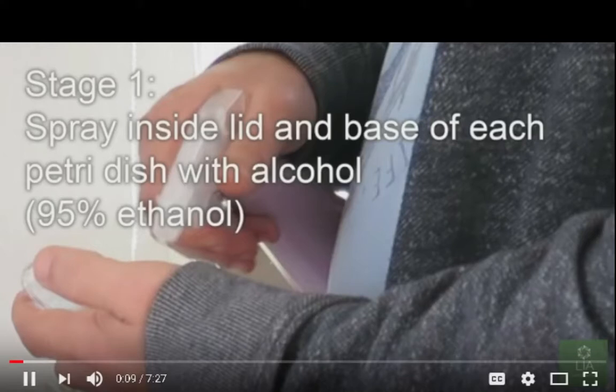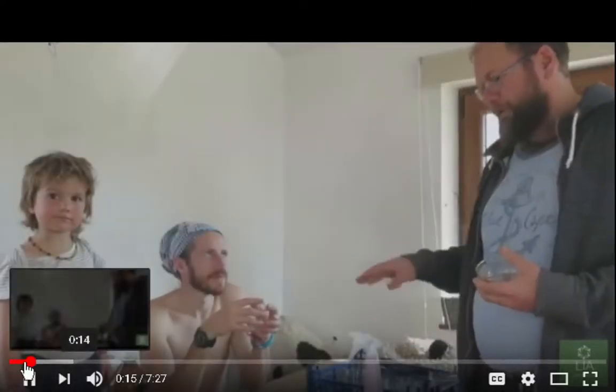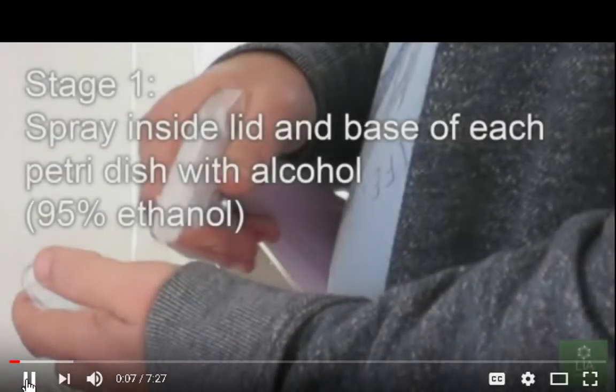He's using 95% ethanol alcohol. So, spray inside lid and base of each Petri dish with alcohol. And he's got his hands all over the dish.